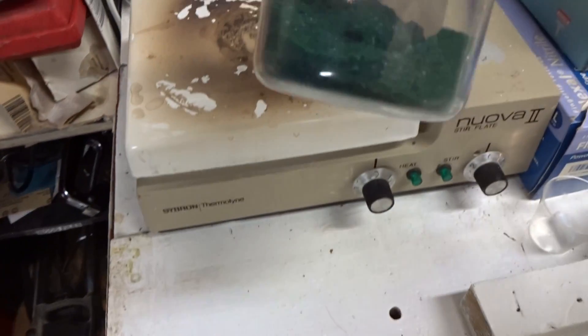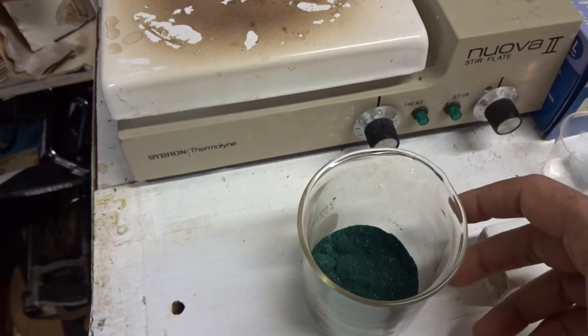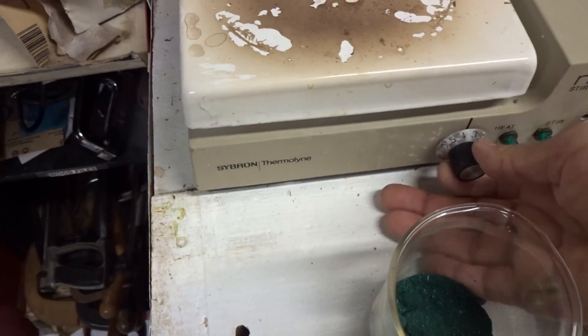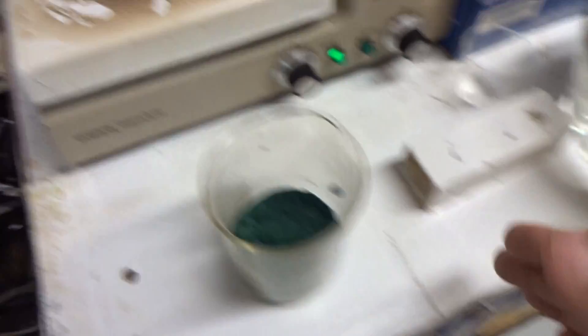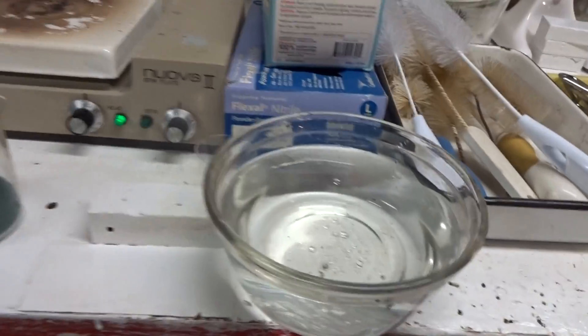We add the boiling water, we add the chemical — aluminum silicate chemical for the zeolite. And this is cranked to ten. I've got a stirring bar too, so I can put that on stir now. Let's see how much water do we add.